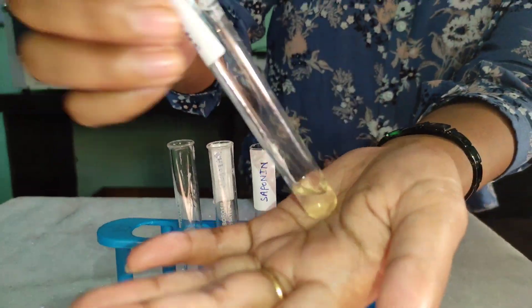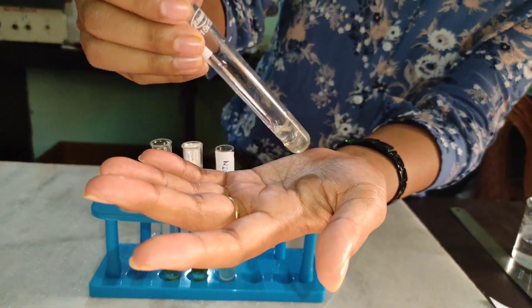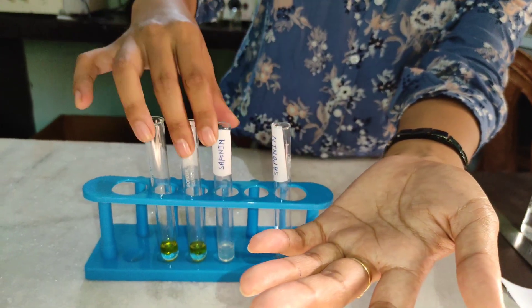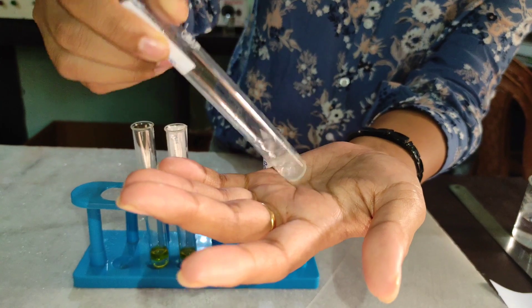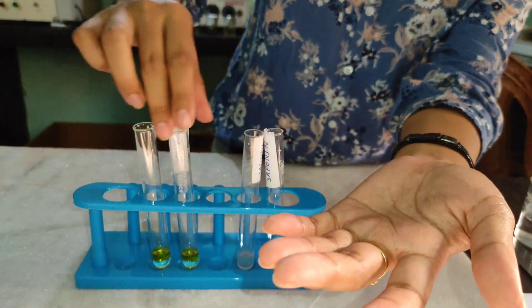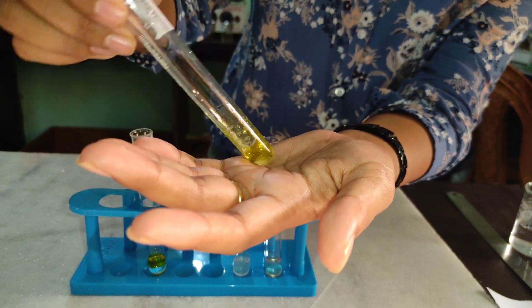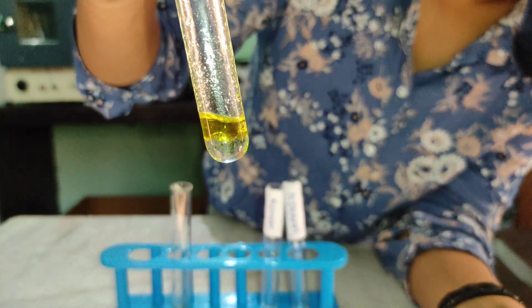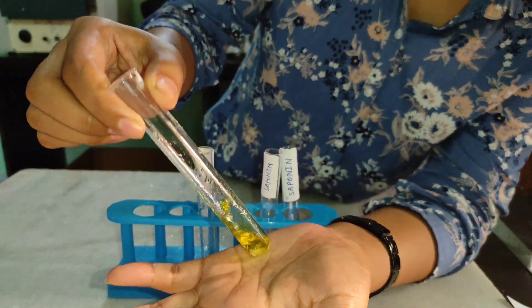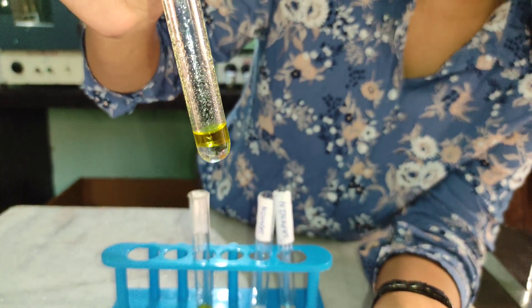You are supposed to vigorously shake the mixture. When we observe that the froth is persistent, we conclude that the test is positive. But since there is froth which is not persistent, the result is negative for saponin in these four extracts.